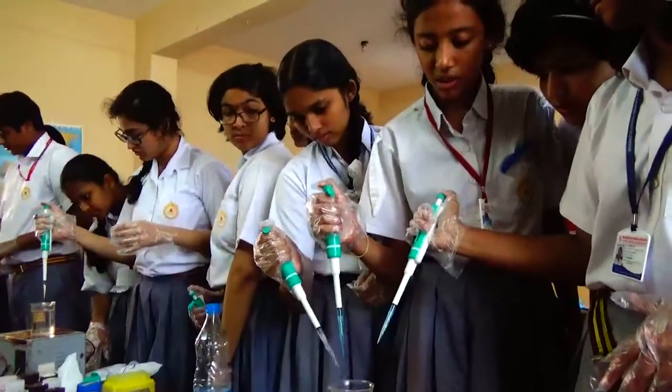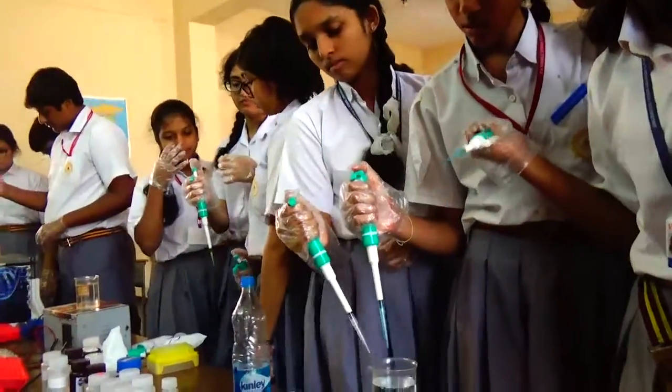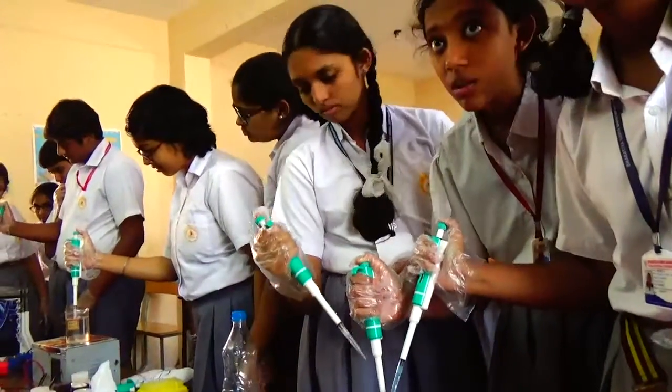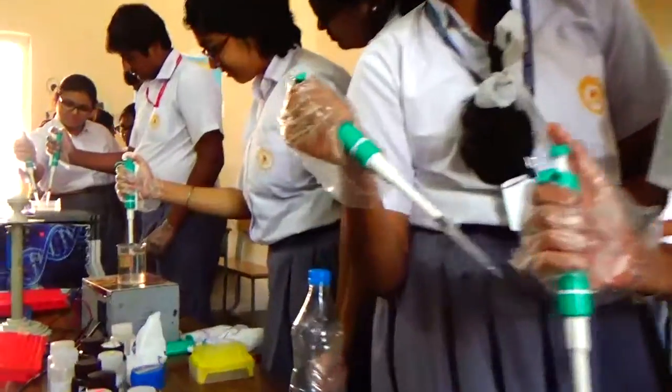Always keep the liquid equal, without any air bubbles. 4-5 people can try together. Don't do like this, it will be like this. Okay, practice it.